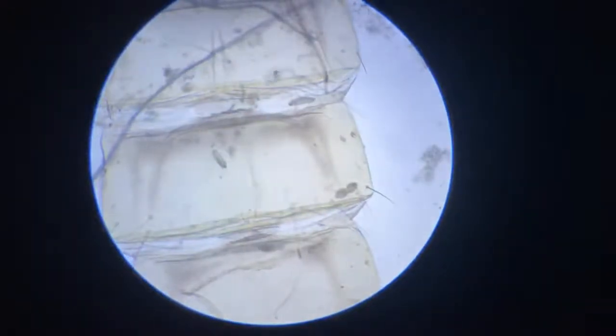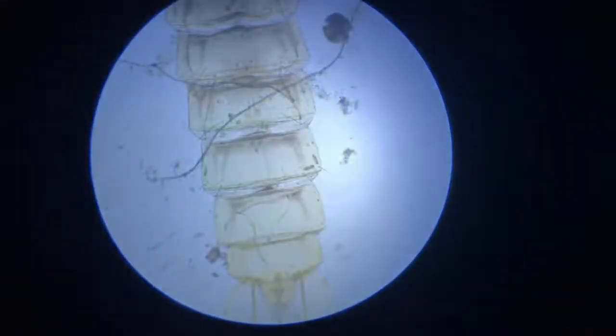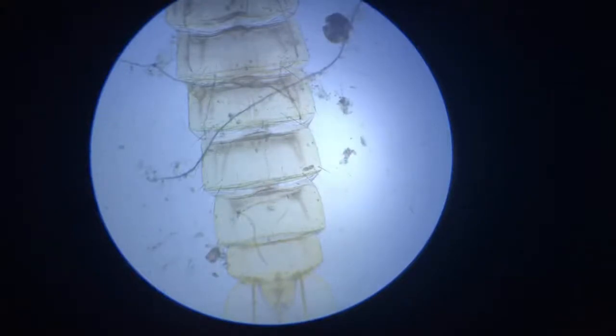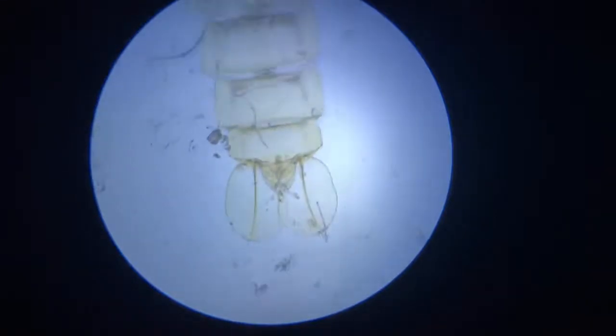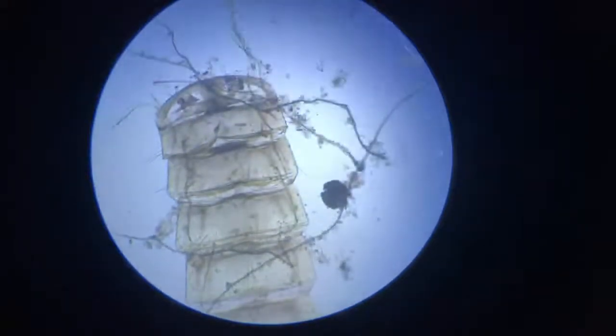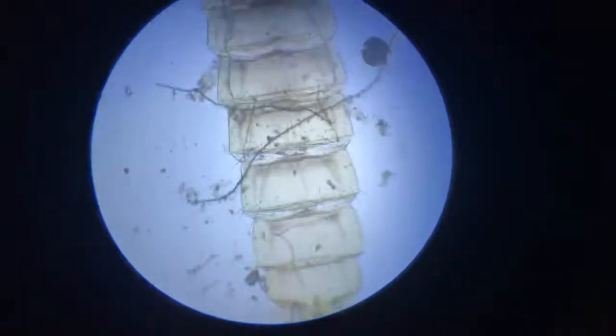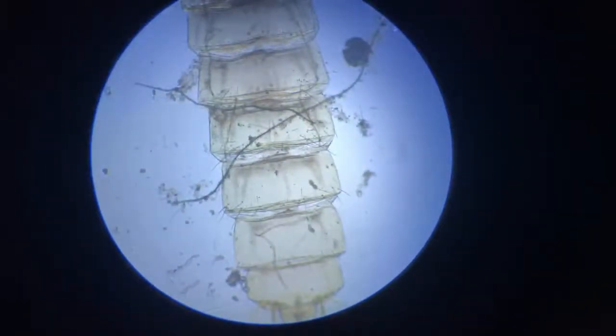I'll change the light settings. Fascinatingly, I'll first show you from a lower magnification what exactly this looks like. This is with the 4x objective — the dipteran body. You can see the dipteran body, and in this body, in this dipteran body whose head portion is gone off, we have a lot of ciliates occupying it as an apartment building.